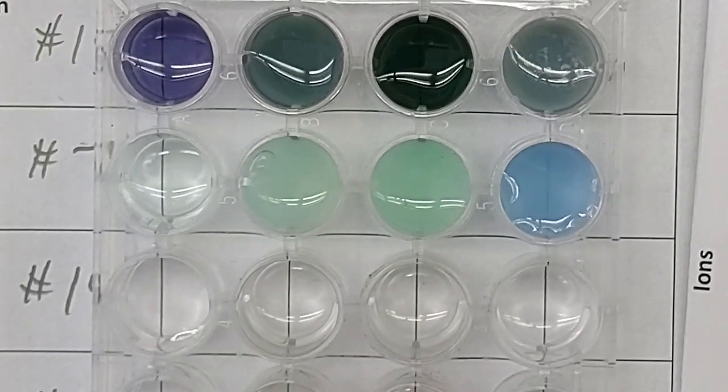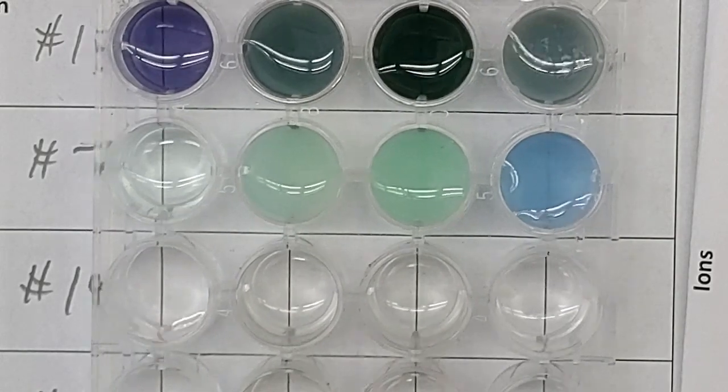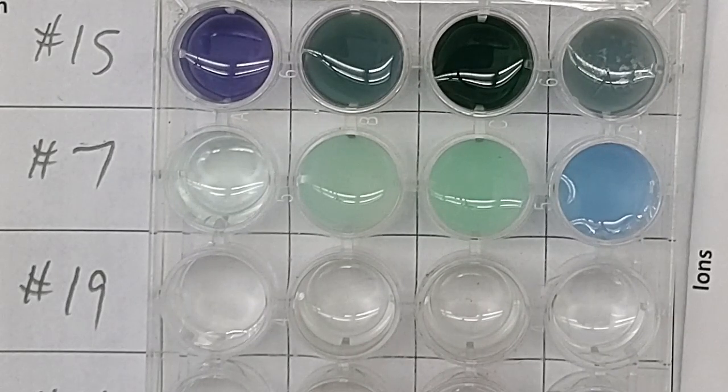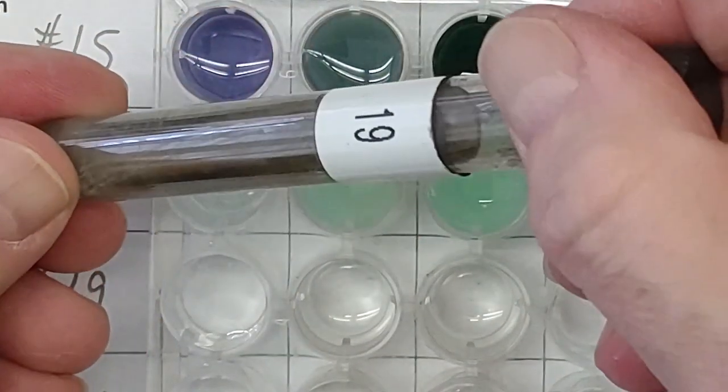And I'll move it so you can see whether you can see through the line or whether it's transparent or not. And match it to one of your previous observations. 19. Oh, sorry, show it to you before I add it to anything. 19.